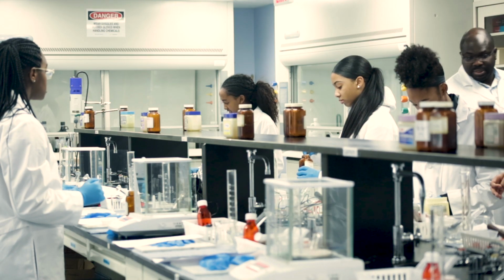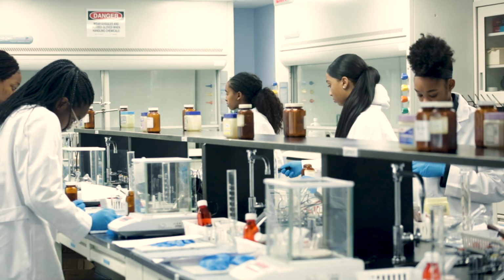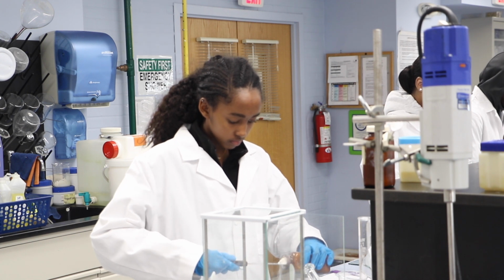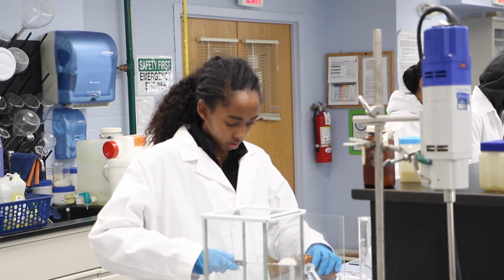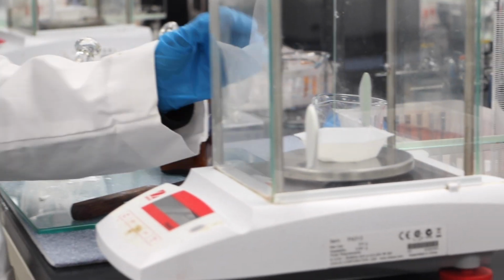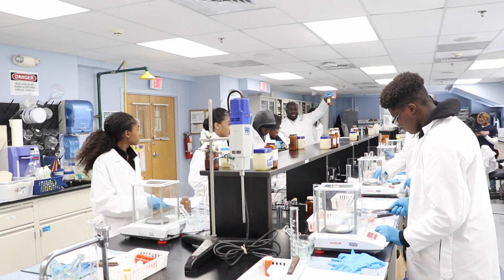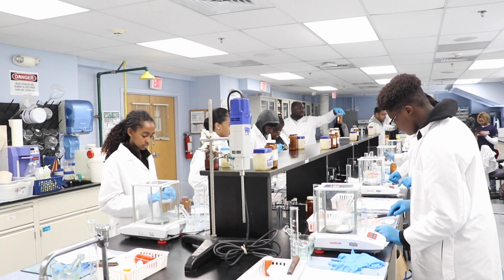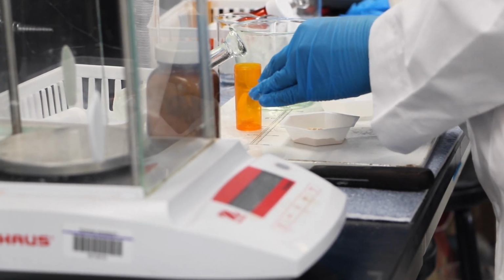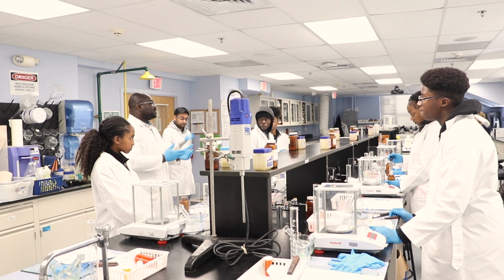Each final capsule that you're going to make is 250 milligrams. That capsule will have 2 components. The first one is lactose. The second component is your drug. So you're going to be mixing 125 milligrams of lactose with 125 milligrams of your drug to give you each single capsule of 250 milligrams. I've told you to make 8 capsules. If you do your calculations for 8, that's going to be 250 milligrams times 8, right?